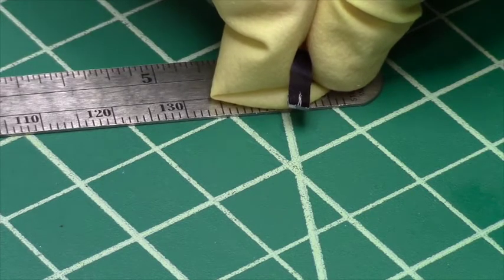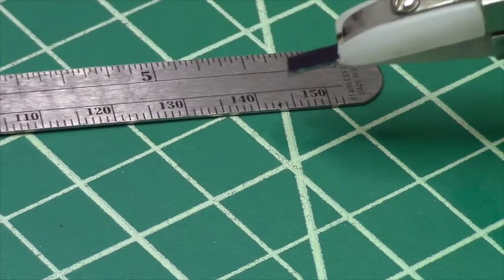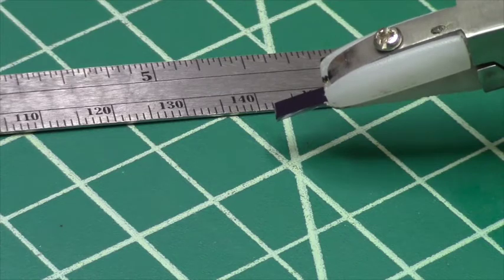Now I've made a short scribe on the edge of the narrow sample, just cleave, and now I'm going to cleave it in half. Listen for the click.